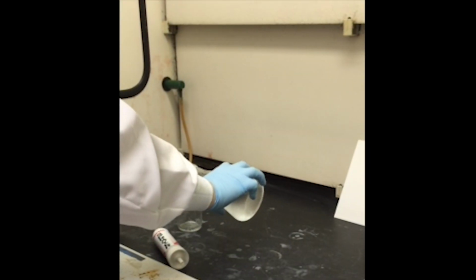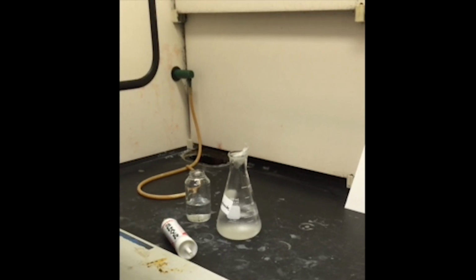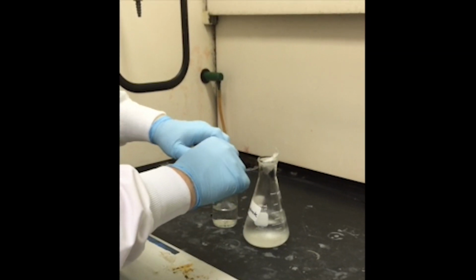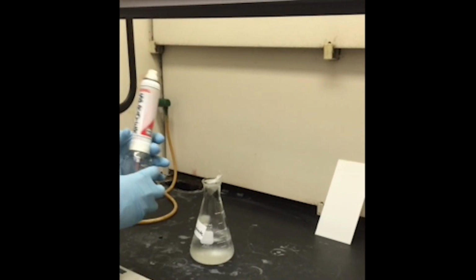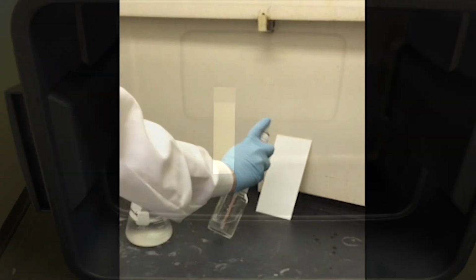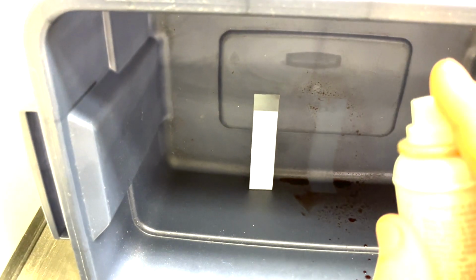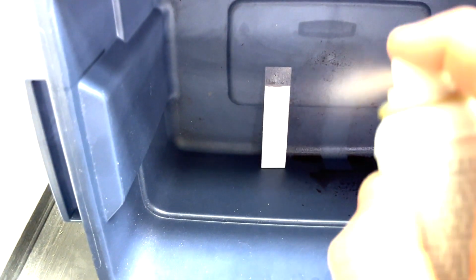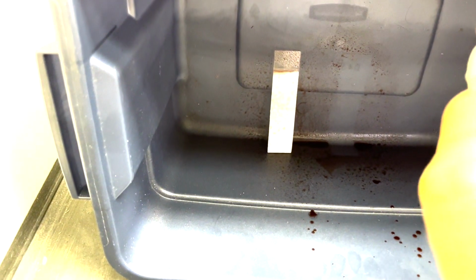So if you want to try and get more sensitivity, or maybe a little more specificity or selectivity than fluorescence involves, you can spray on a visualization reagent. So you pour that in this container, you put on these aerosol tops we have, and then you can spray down your plate with the visualization agent. The most common visualization agent we're going to use is called iodoplatinate, and that's just going to react well with a lot of different amines. It's a pretty generic one. That's what I'm spraying this plate down with.